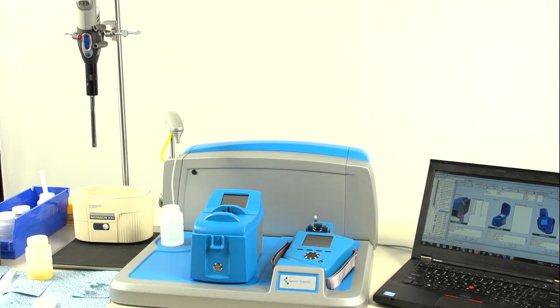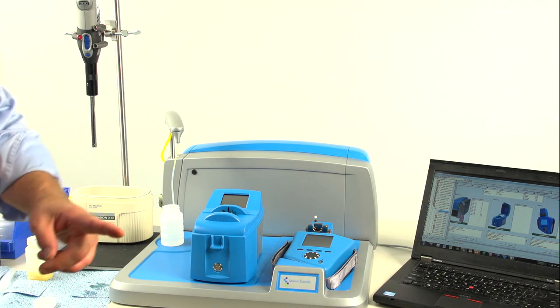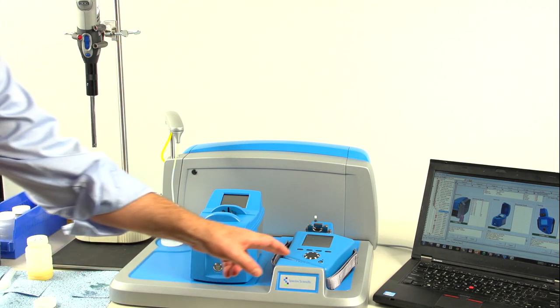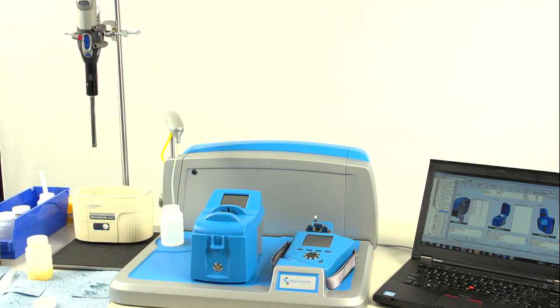So, the FluidScan results have completed while we were preparing the sample for the LNF. Once the results are complete, you simply select Save, and again, it will transfer data into AMS.